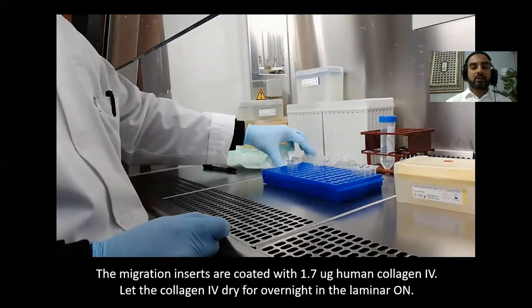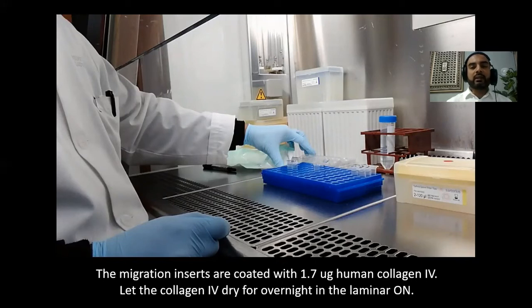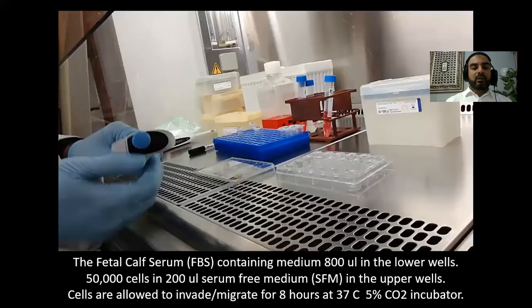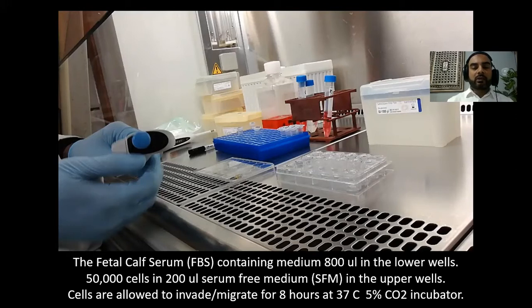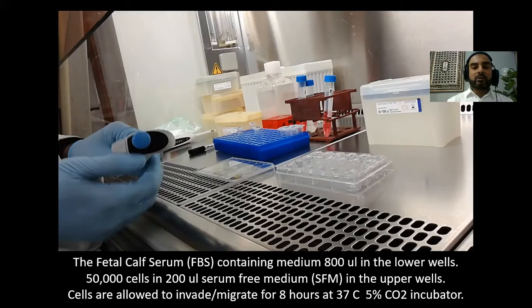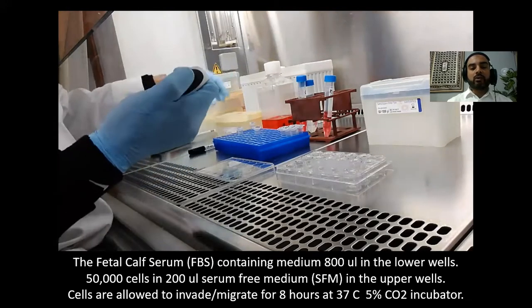First, we did the coating with 1.7 micrograms of collagen IV and then let the inserts dry overnight. The next day, we took out the inserts and put medium in to reconstitute them. After reconstitution, we now have two things ready for the next step.